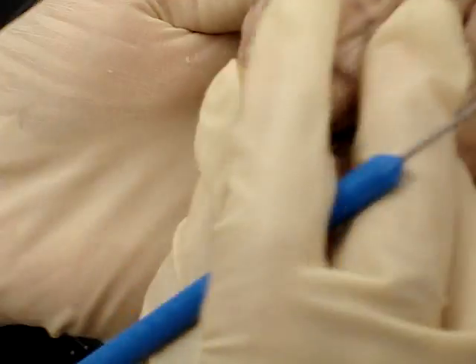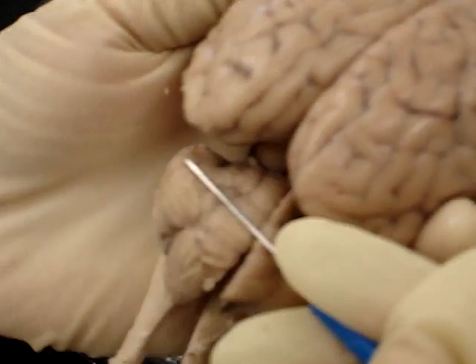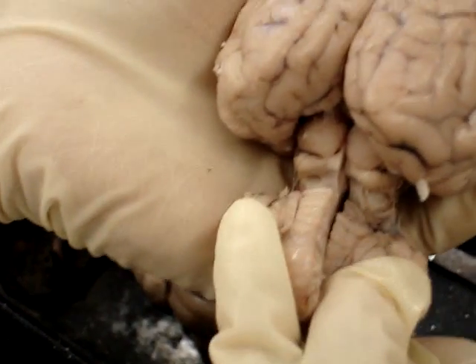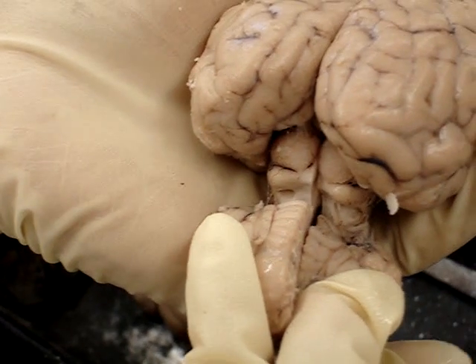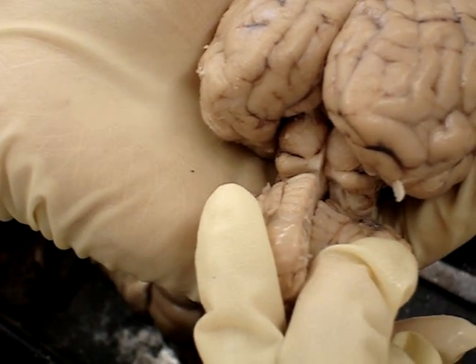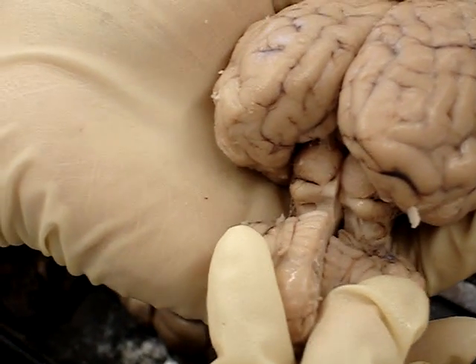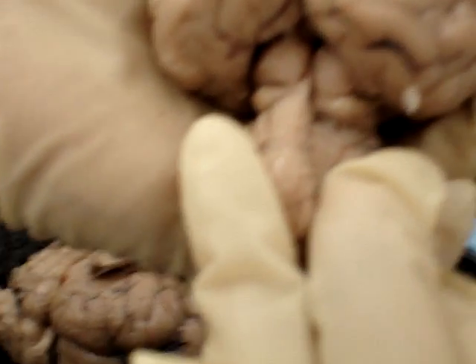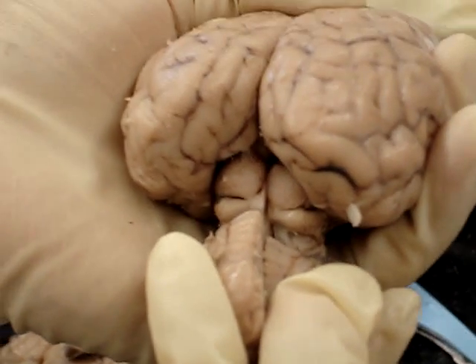And above that is the superior colliculus. If you put the two halves of the brain together and look down, you can see four bumps. The top two are the superior colliculus, and the bottom two are the inferior colliculus.